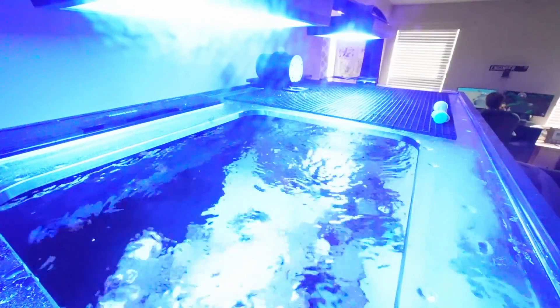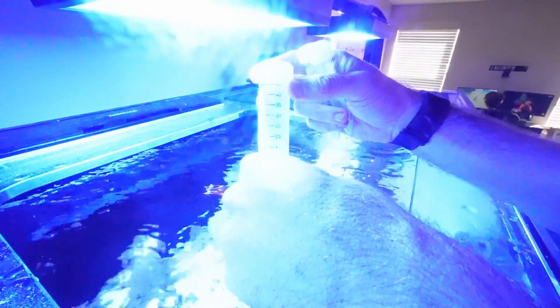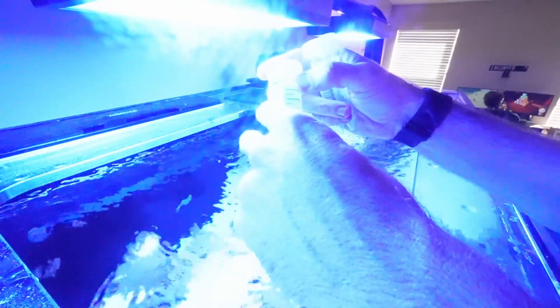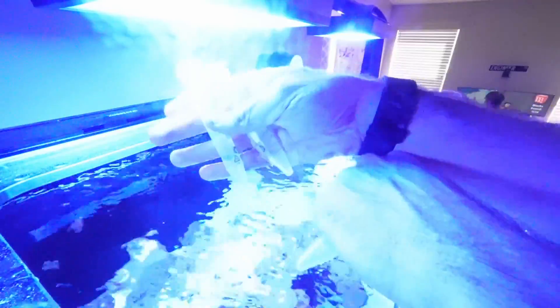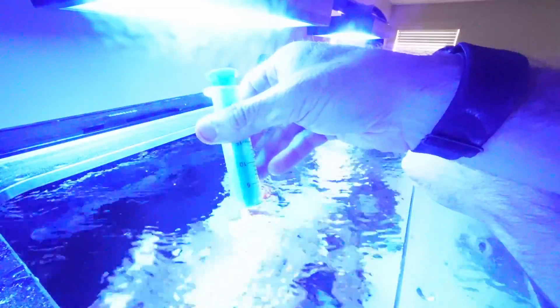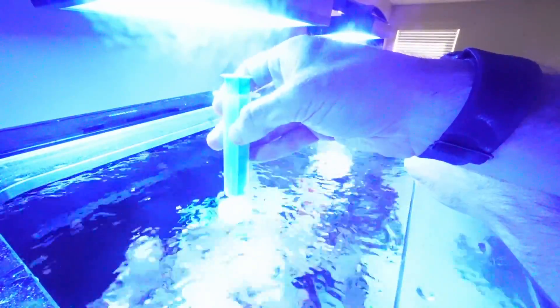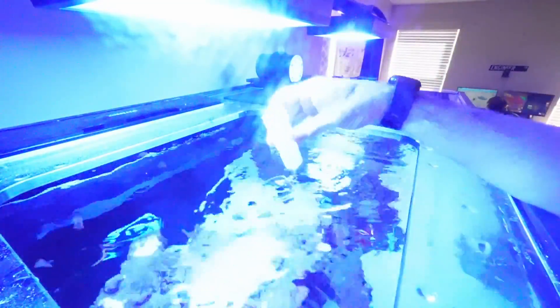Let's work on collecting our samples. In the Fauna Marin kit we get a total of four vials. The one with the red cap will be used for your RO water. The bigger vial that is 50 ml in size will be used for 50 ml of unfiltered sample, whereas the two smaller ones will be used for a filtered sample — and when we fill up the two smaller ones we'll be using the included filter. I've already got all my labels on here, so I'm going to work on filling this up.